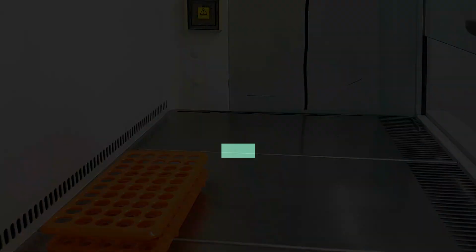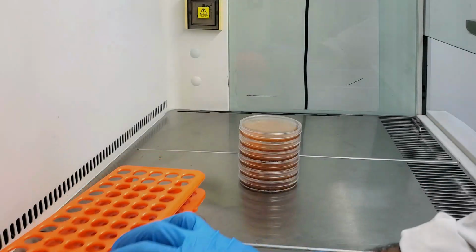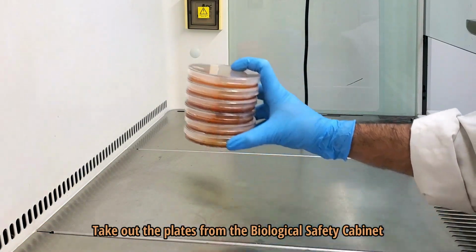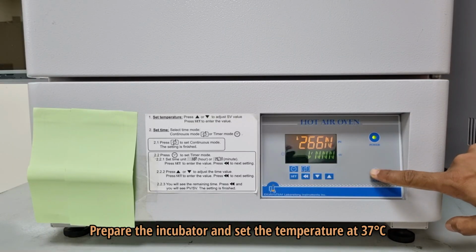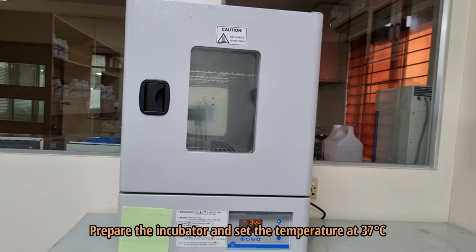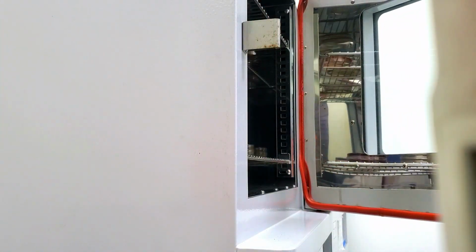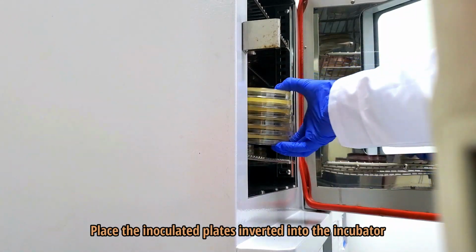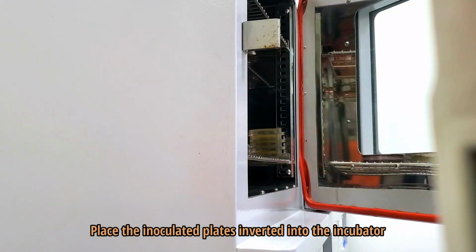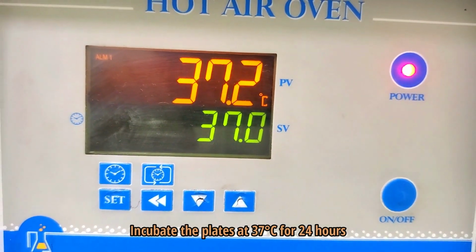Once the spreading is done, we have to incubate the inoculated plates. Prepare the incubator and set the temperature at 37 degrees Celsius. Place the inoculated plates inverted into the incubator. Incubate the plates at 37 degrees Celsius for 24 hours.